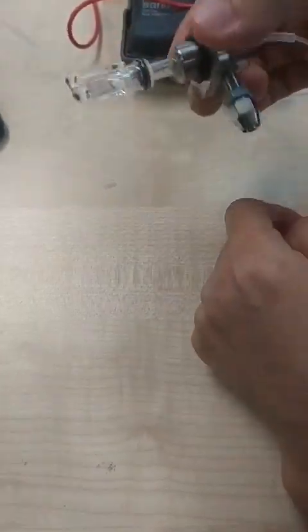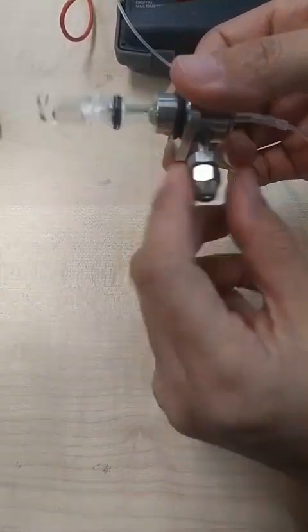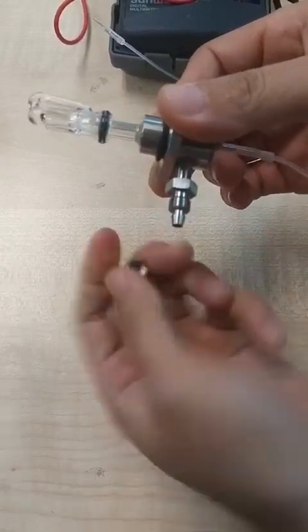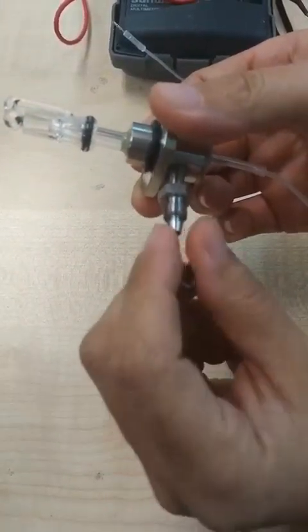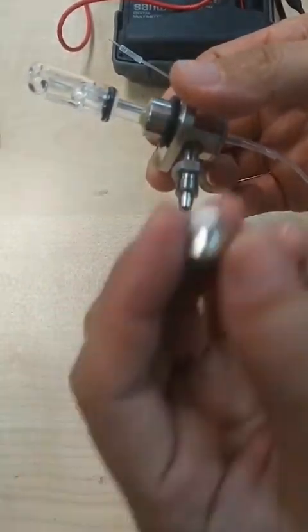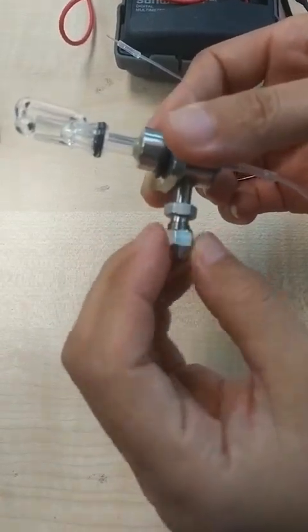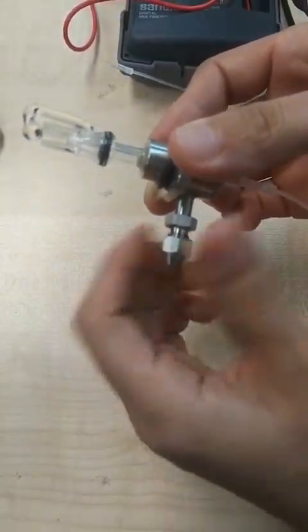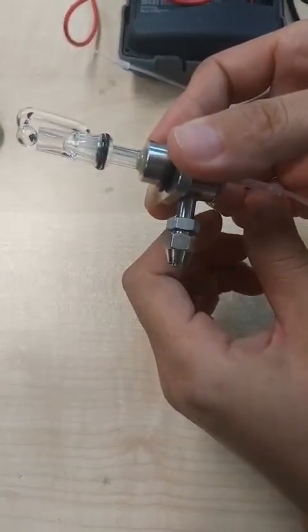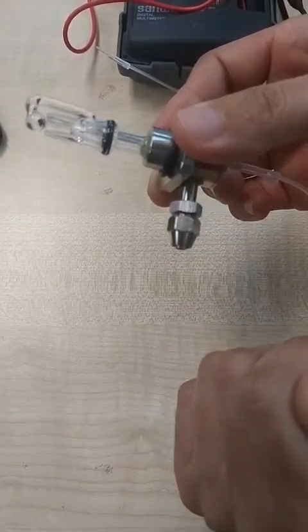You can adjust the angle based on your sample location. Here you need gas. Take down this one. If you cannot find the suitable tube, you can call us and I will give you a flexible tube. Enter this one to the tube first, then put the tube here. Rotate this one to tie the tube. Maximum pressure is 0.2 MPa. Flow rate you can control to about 10 milliliters per minute.